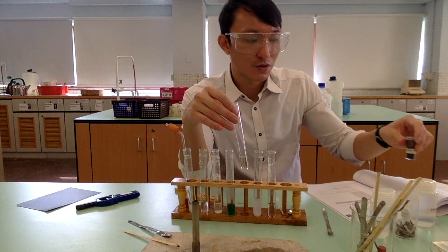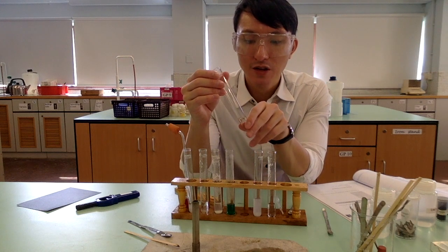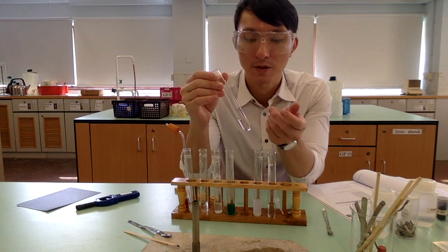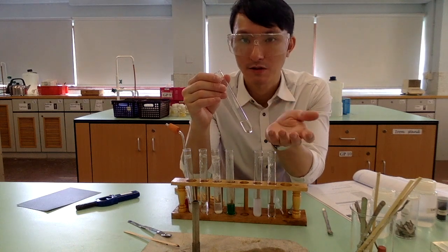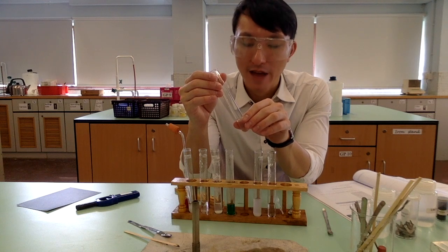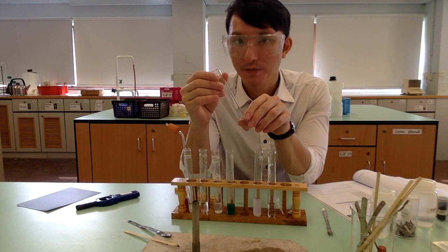Then we also do a very similar reaction with calcium hydroxide and hydrochloric acid. And basically, we see the white solid has dissolved. Now, actually, I haven't shown it to you when I'm doing the demonstration, but you will also expect the contents to get much warmer. The reason is that the reaction between calcium hydroxide and hydrochloric acid is exothermic. That means the reaction releases quite a lot of heat, which is able to heat up the contents. So bear in mind that in the reaction between metal hydroxide and acid, not only does the white solid dissolve, but the contents also get warmer.